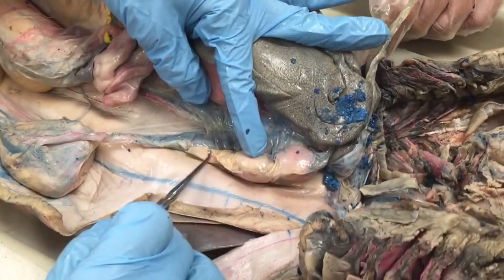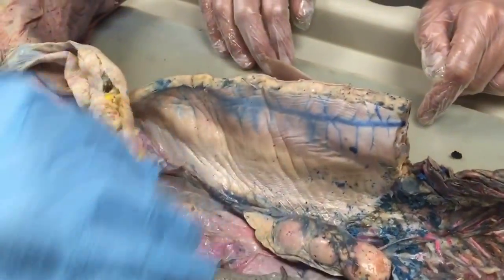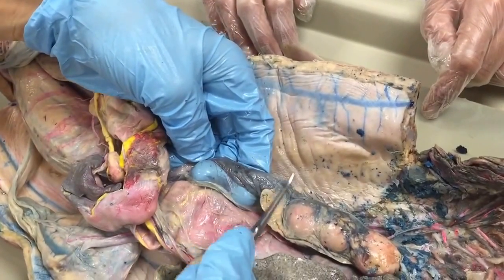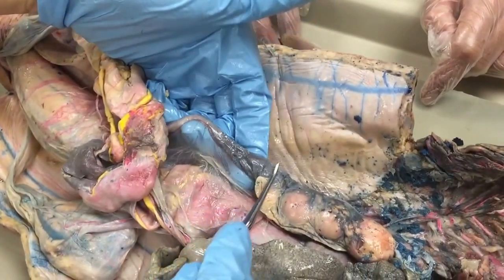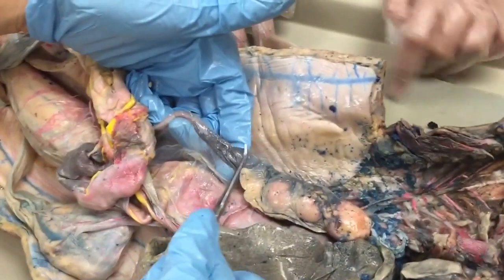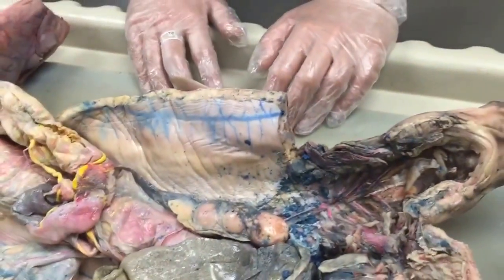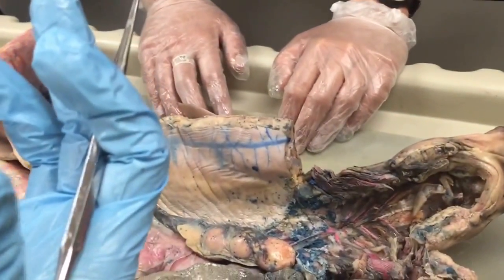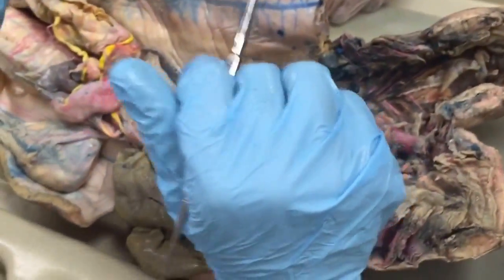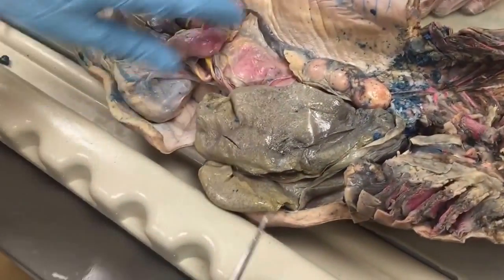There's also a shell or nidamental gland here at the bottom of the ovary, and it's a little bit easier to see on this side. This is the expanded part of the oviduct — this expanded part here is the shell or nidamental gland. It's commonly called the shell gland because it helps produce the encasing around the embryo, like a shell. So like in vertebrates that actually produce a shell, the shell gland produces the actual shell-type tissues.